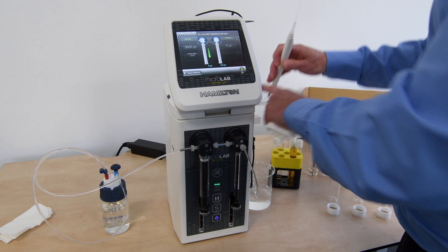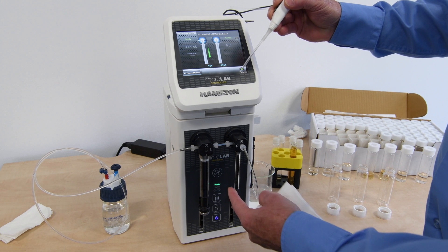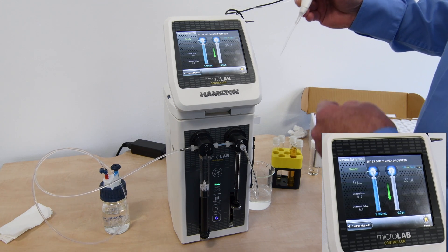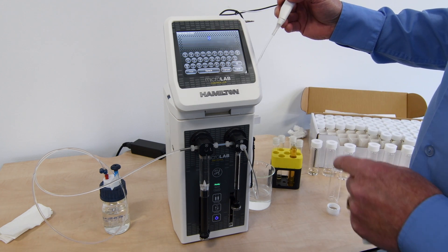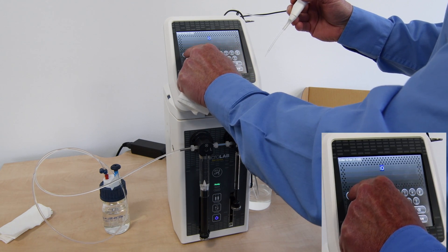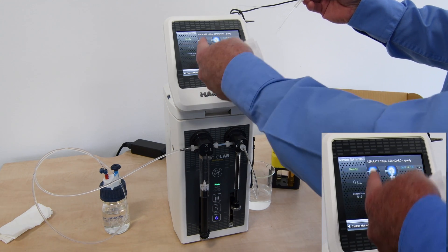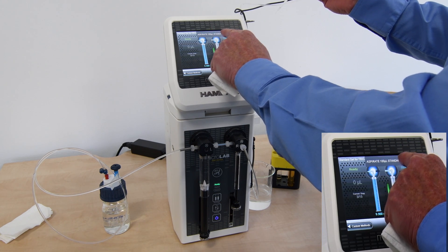We'll take that off-site and I can initiate using the actuator button here. You'll see the program starts, aspirates our diluent, and then picks up our air gap. The air gap is picked up, and then it prompts us to give an ID for the standard we're going to use. The ID of this standard is qwerty, and we're saving that.